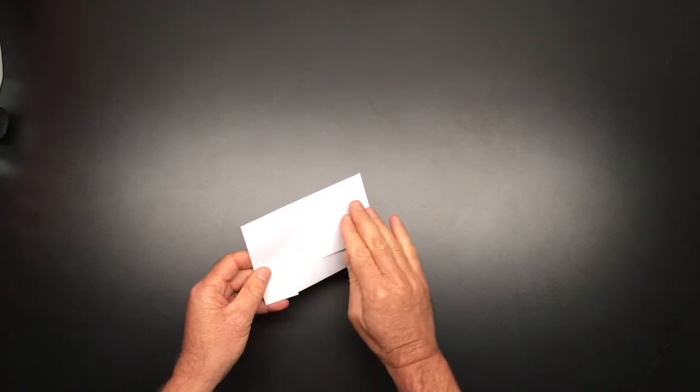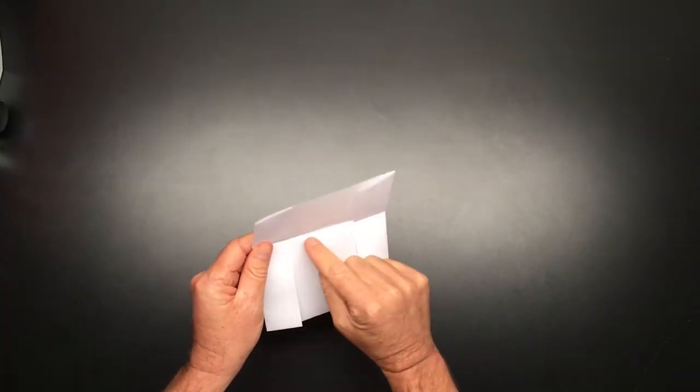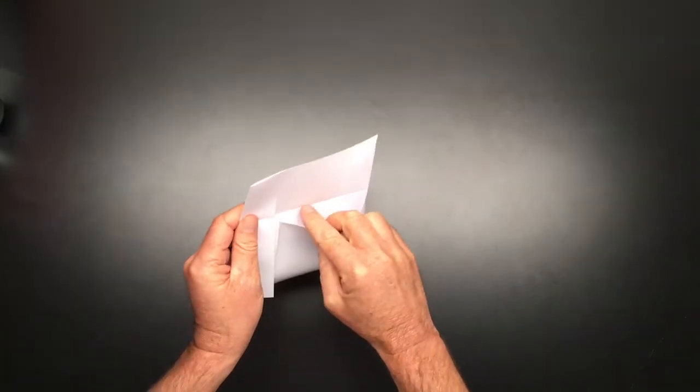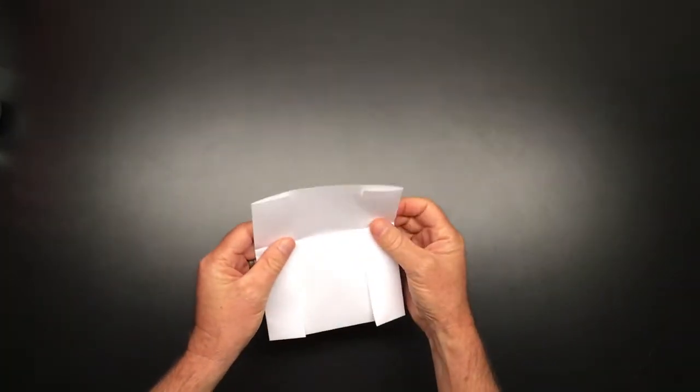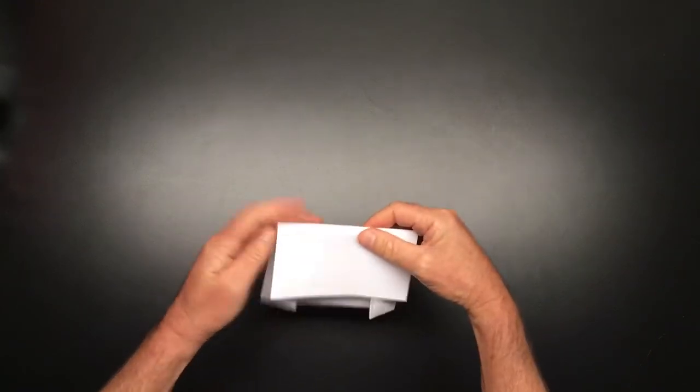This is the front of your packet where your label goes. You open it up, there's the pouch inside, and most importantly there's no gap between this fold and this edge so the specimen cannot fall out no matter how small it is as long as this top is closed down.